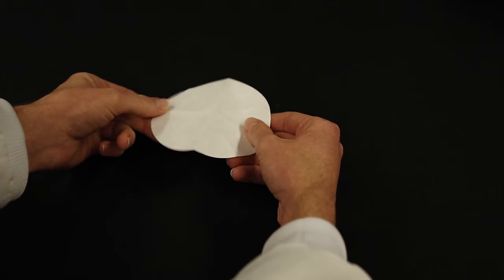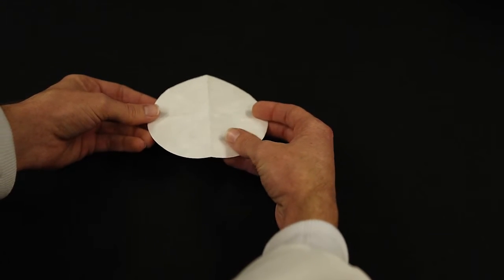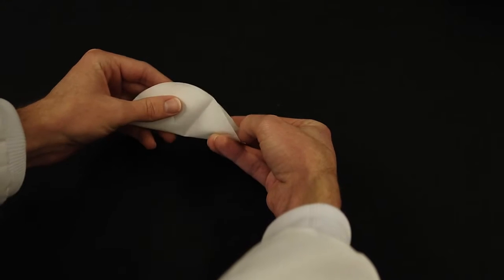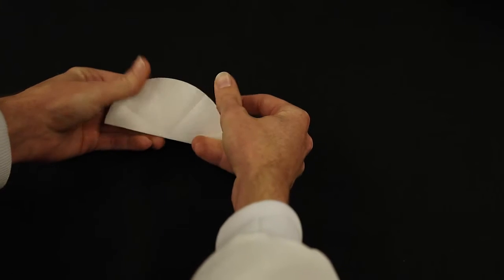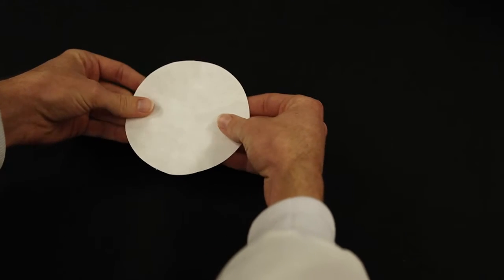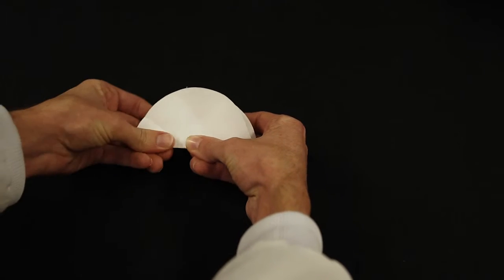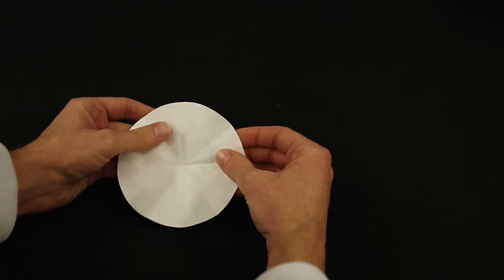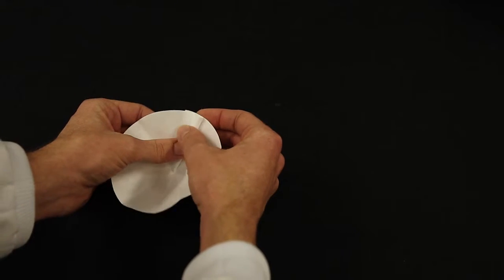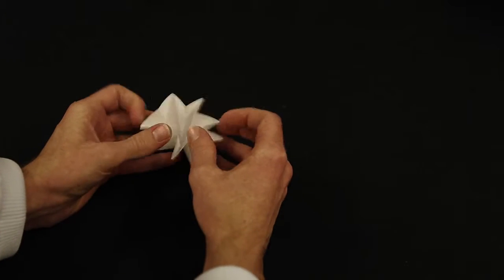Now turn it over, and you will do the same thing on the other side, except that you will line up and fill in the spaces between the pleats that you just made. Fold it in half, line the creases, and you will do that a total of 4 times with alternating creases. This will give you 4 pleats on each side. When you are done, you should be able to fold the pleats alternating until you have a tight, pleated paper that you can sit inside of your funnel.